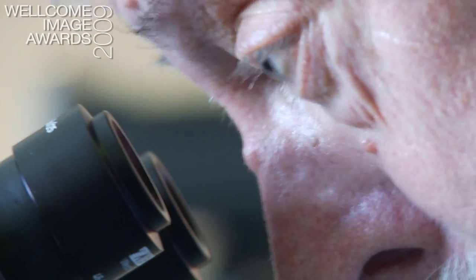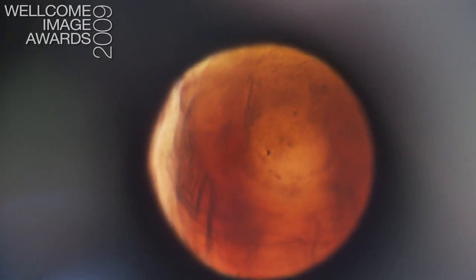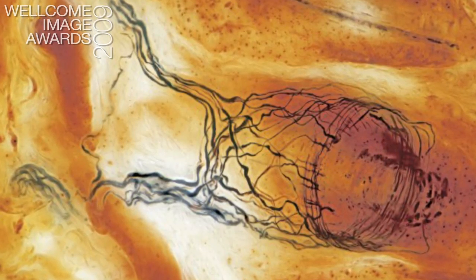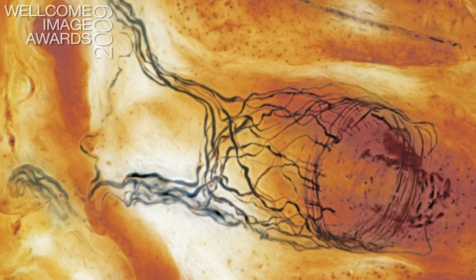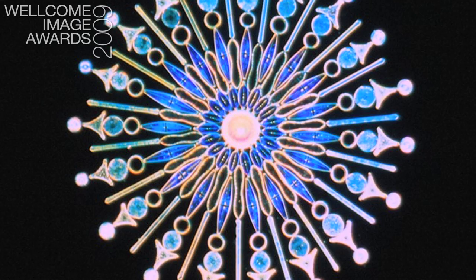I may use a computer to fire the shutter, and the image appears on my monitor screen. Once I've collected the images — and I may need to take several of a specimen at different levels, because the depth of field of a microscope is very small — if you're looking at something thick, you may have to take photographs at different depths through the specimen and then use software to stack all the images so that you get a much clearer image of what the thing really looks like. But most of the colours you see in images done with Rheinberg illumination, cross polars, and so on, are just the consequence of the laws of physics playing out in the microscope.